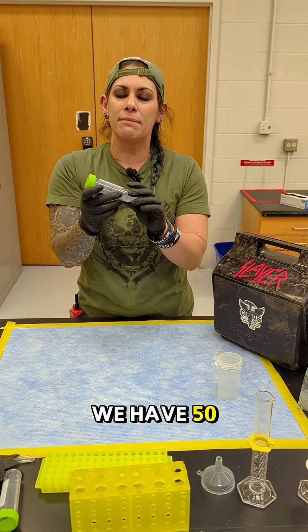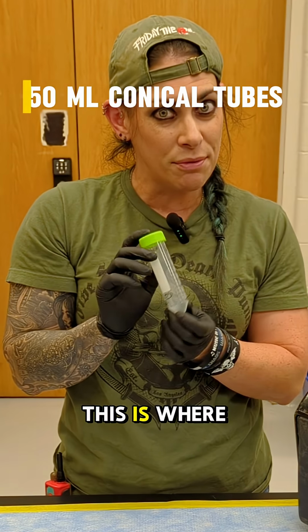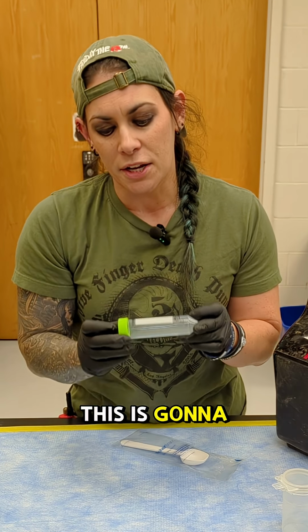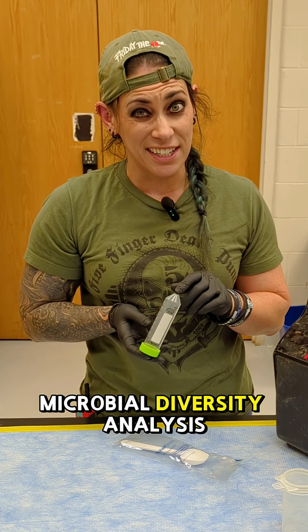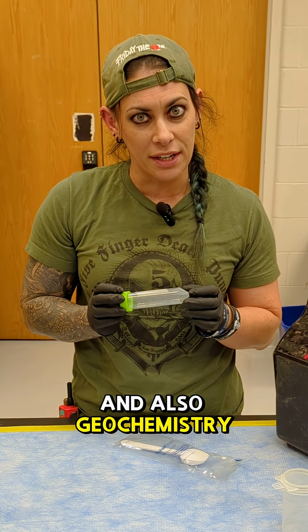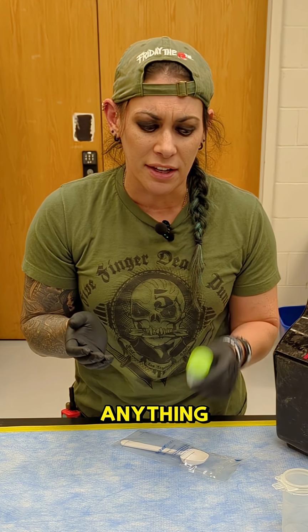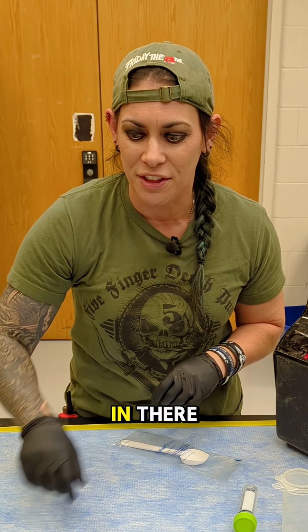We have 50 milliliter conical tubes. This is where all of our sediment goes. We scoop our sediment with these sterile spoons or scoops. This is going to be for our microbial diversity analysis and also geochemistry done on the sediment itself. And then we keep it around in case we need to do anything like what genes are in there and what proteins are in there.